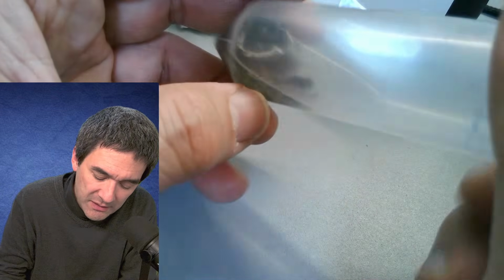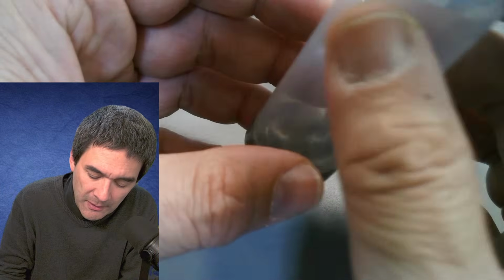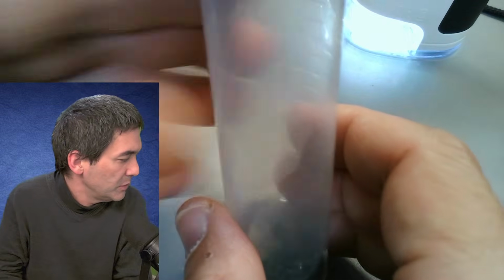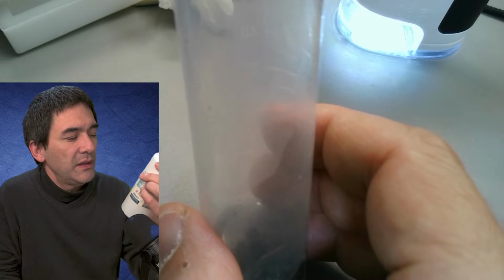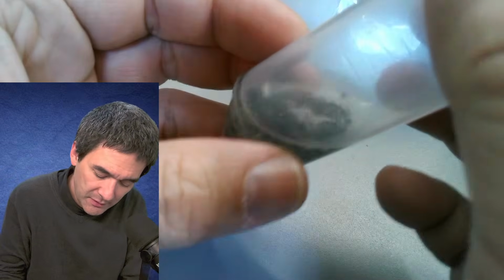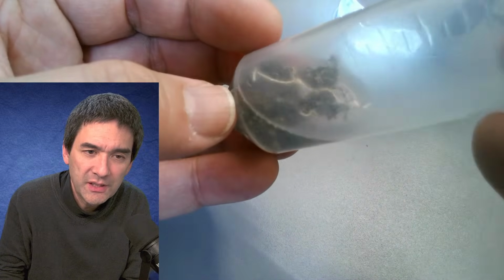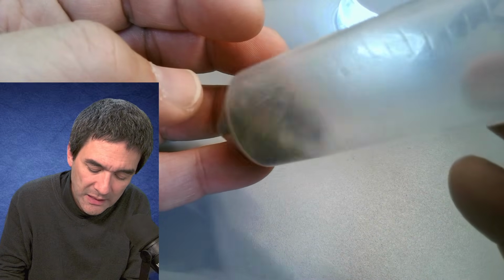Okay, but this is basically a method of concentrating the diatoms. The problem only is that it can sometimes be a bit difficult to get 30% hydrogen peroxide. You can also try to use a hand disinfectant, as they very often contain 3% hydrogen peroxide, which is readily available. But the more concentrated, the faster it will work. So this means a little bit of patience, and we're going to see whether I have to add a little bit more or not.